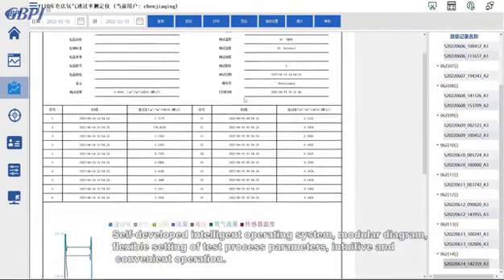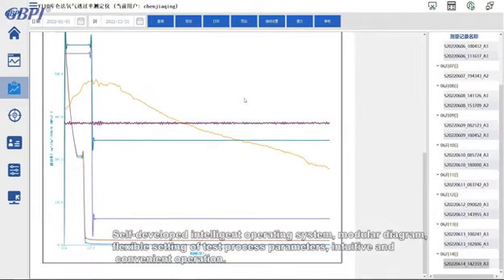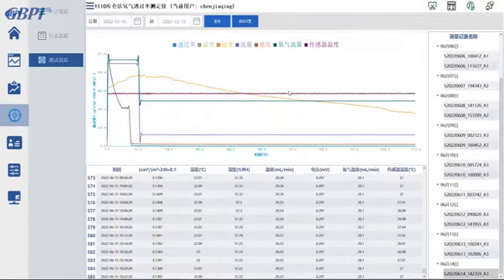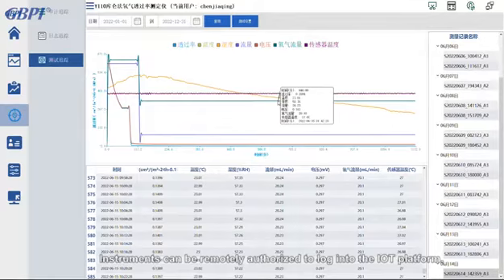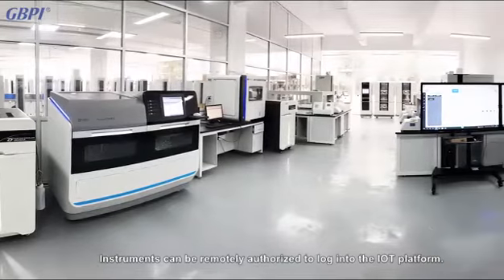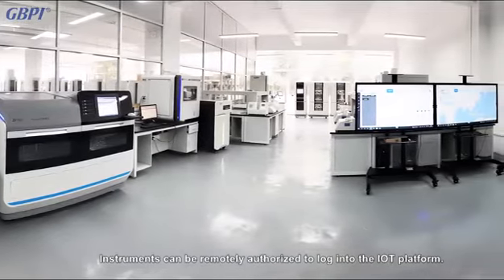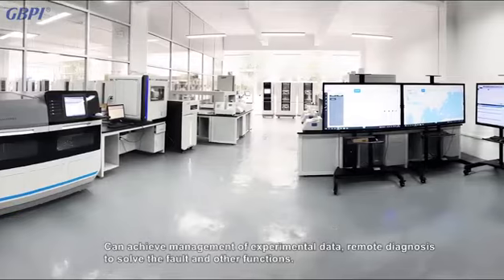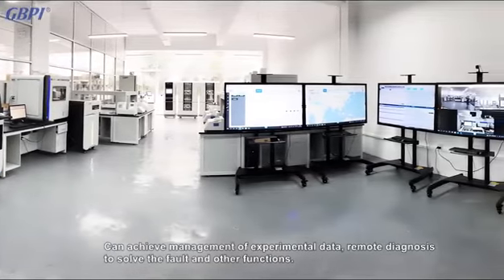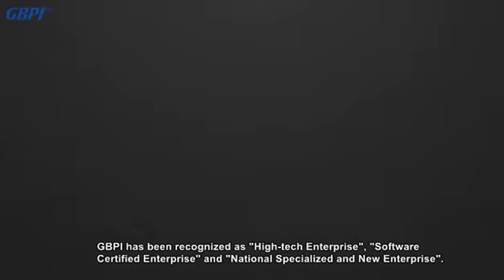It allows flexible setting of test process parameters with intuitive and convenient operation. Instruments can be remotely authorized to log into the IoT platform, enabling management of experimental data, remote diagnosis, fault resolution, and other functions.